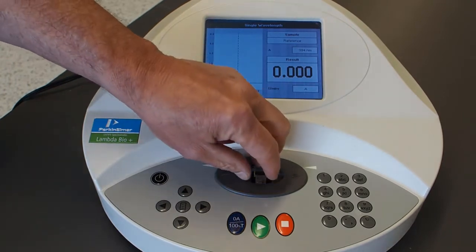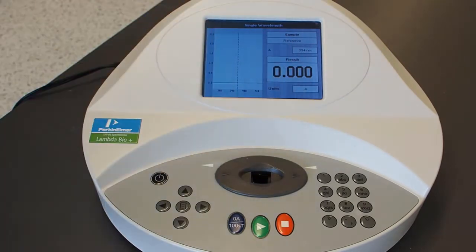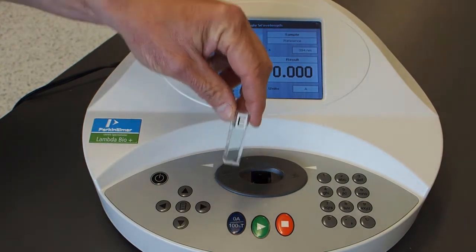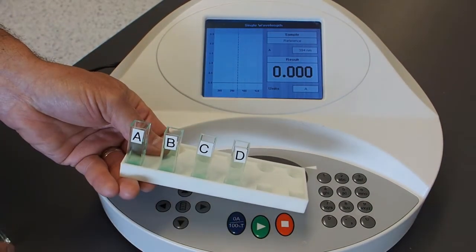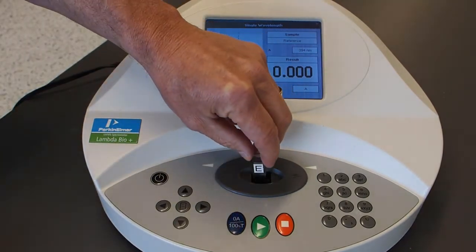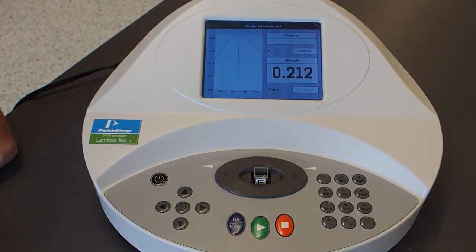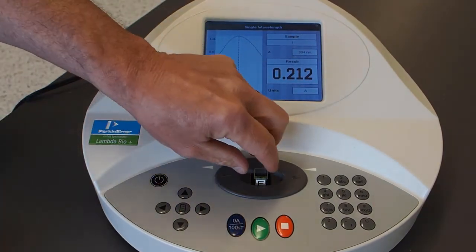That's recorded, and now our absorbance measurement is zero as it should be. That's actually our first data point: with no nickel, you have no absorbance at 394 nanometers. Now we're going to measure our five samples, A through E, starting with the least concentrated — sample E. We put that in the cell holder, press record, and that has an absorbance of 0.212 absorbance units.